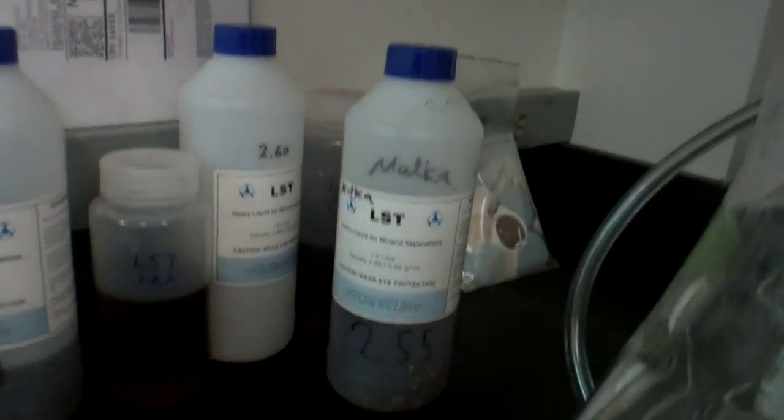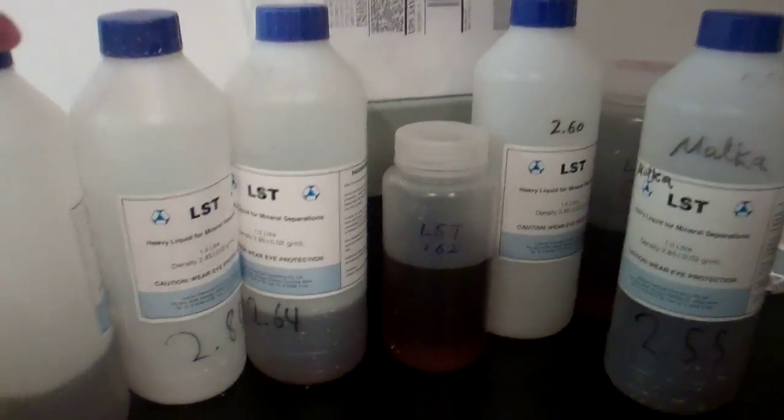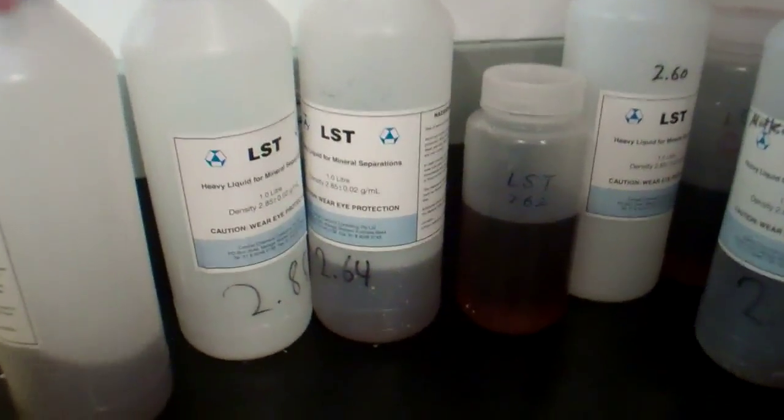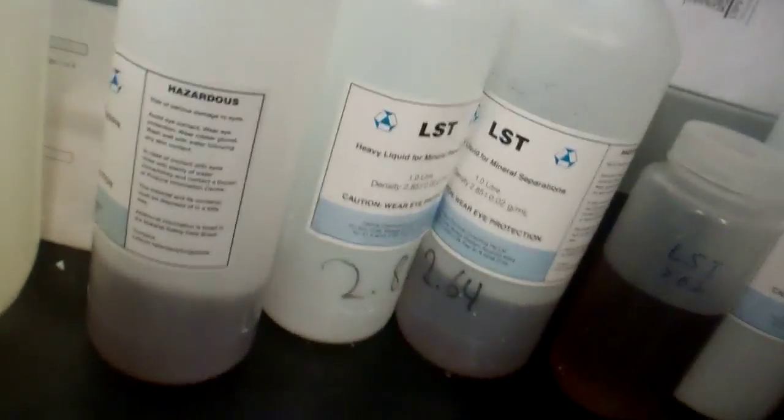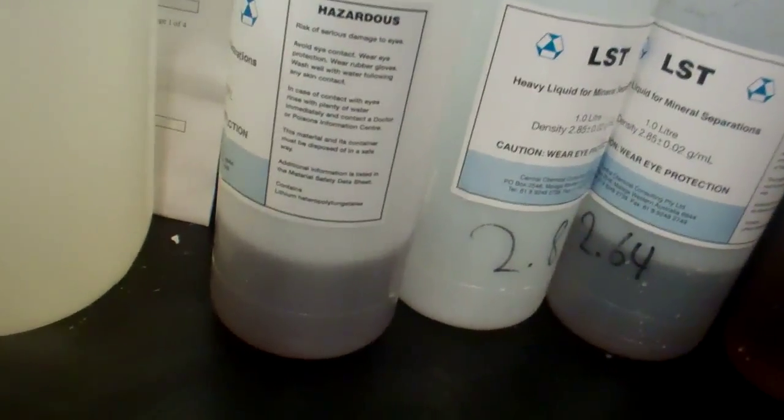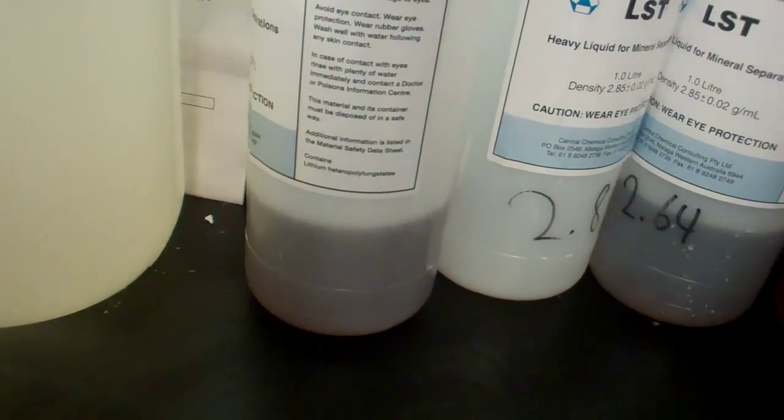So after this, we do something called heavy liquid separation. When this is done, we're going to put what we have left for non-magnetic particles in sample CB2. I'm going to put it in a vial like this, fill it with heavy liquid LST, which stands for—hold on—lithium polytungstate. Am I right? Oh man, lithium hetero polytungstate. I forgot the hetero.